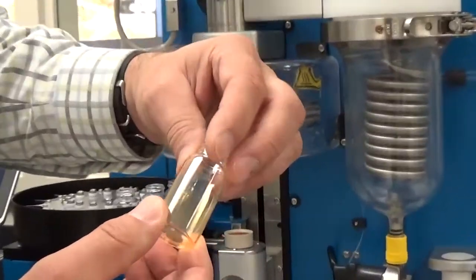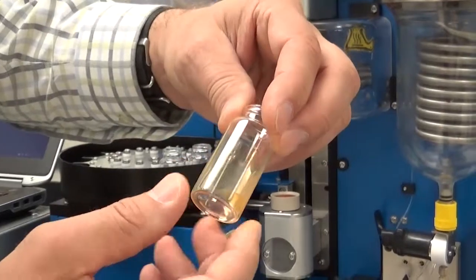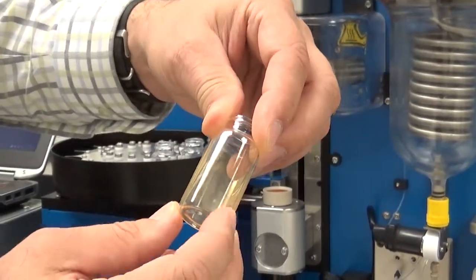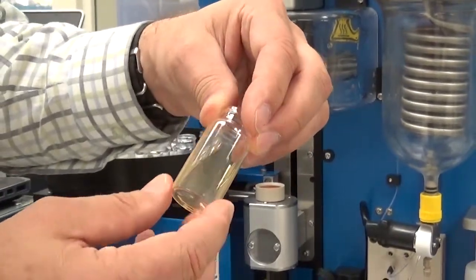So now you can see, after just a few minutes, all the material that was in the reaction product vial is now just dried to the side.